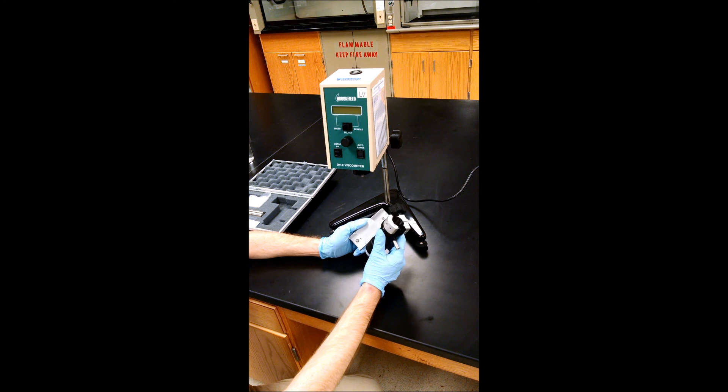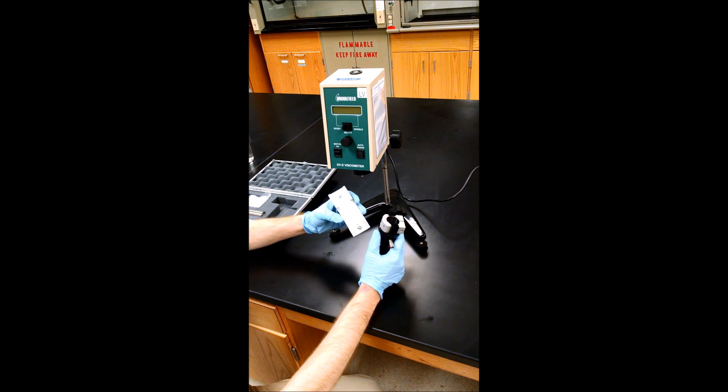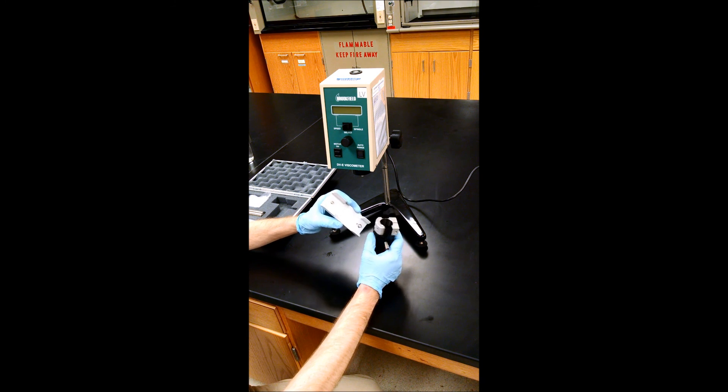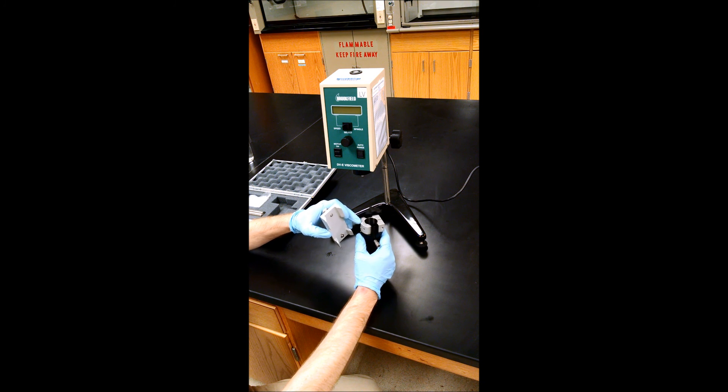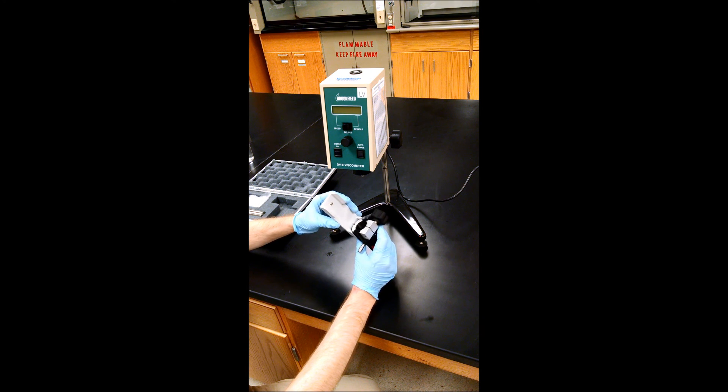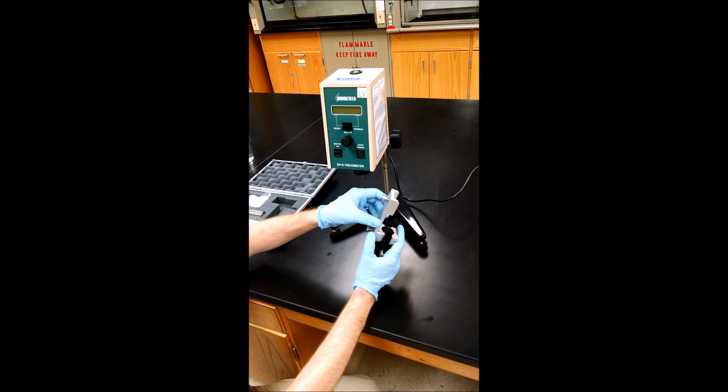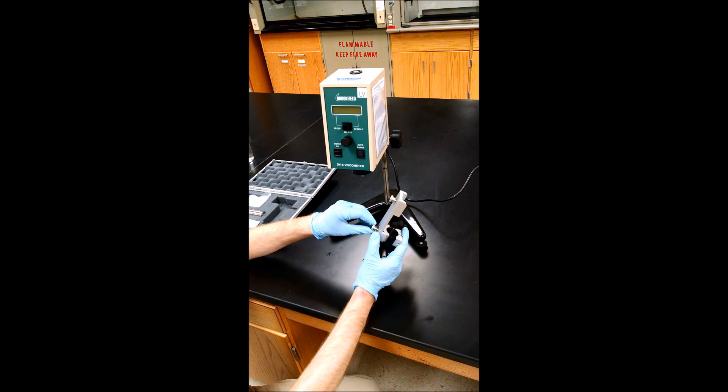To attach the ultra-low adapter to the viscometer we use this bracket, and you see there's a pin here that's going to line up with this depression in the top of the adapter. Screw that on.